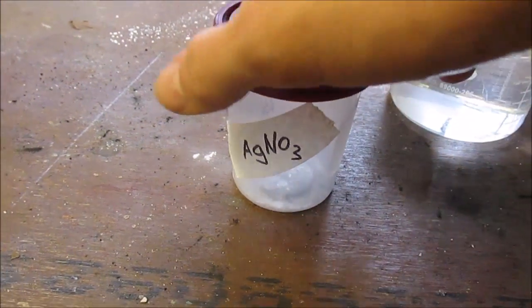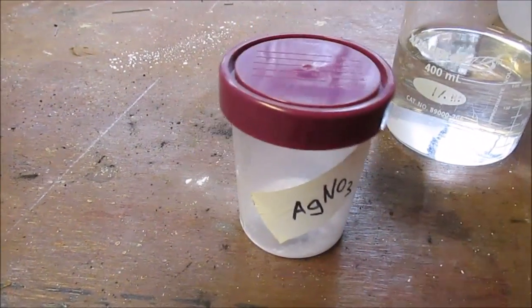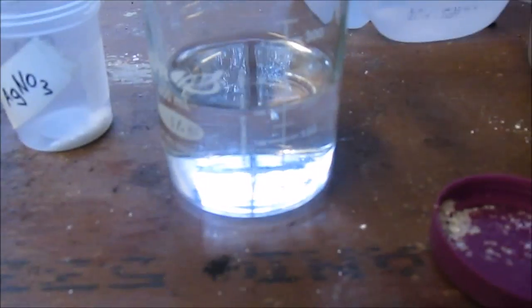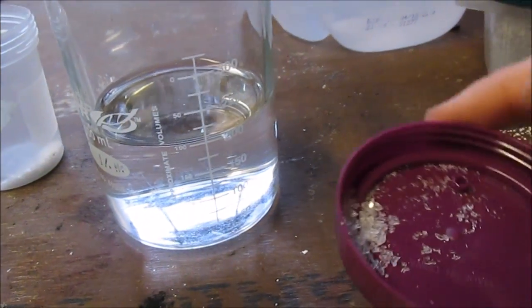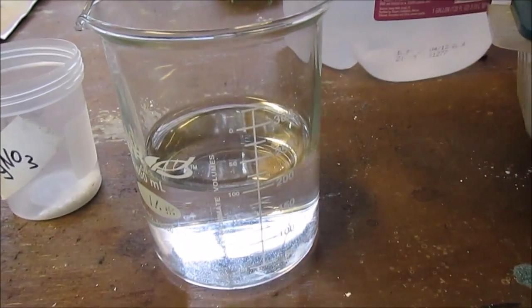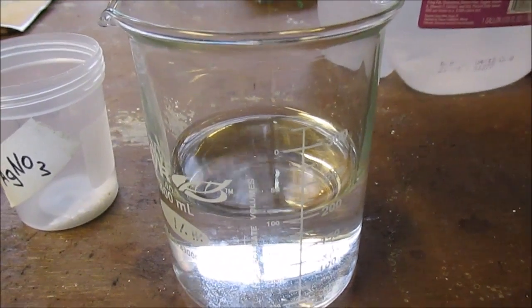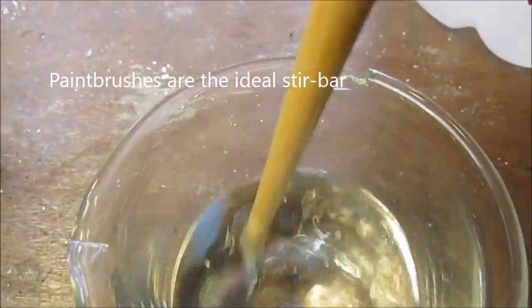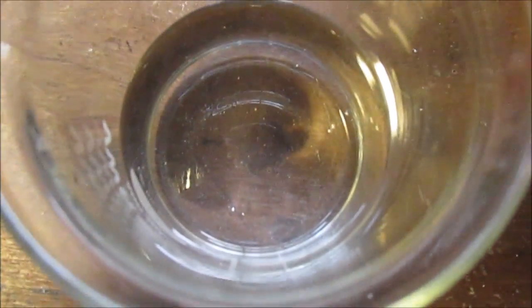Next, you add in a little bit of silver nitrate. The silver nitrate dissolves into the water and becomes aqueous. I'm just going to use a very small amount — I really don't have much of this stuff left. There we go, that's thoroughly dissolved in there.